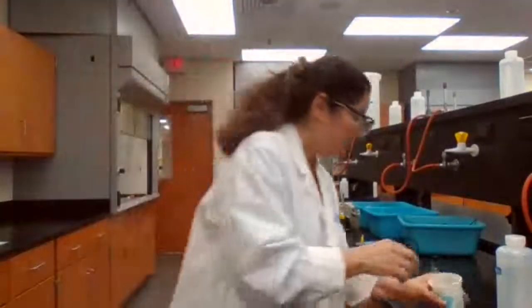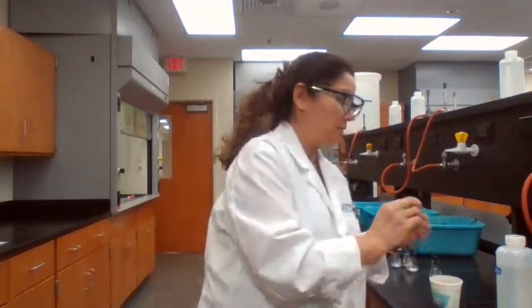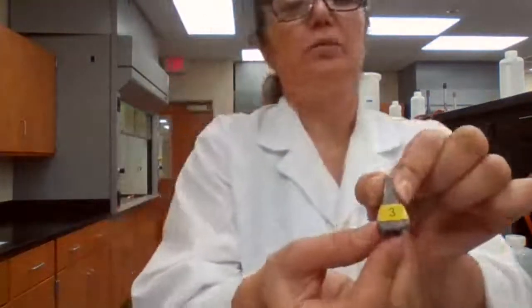And the rest would be calculation, which you are going to do yourself. So it's asking to do two solids. So we are going to do solid number, take another solid right here. Solid number 3.